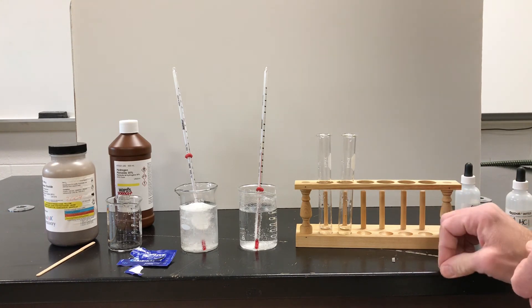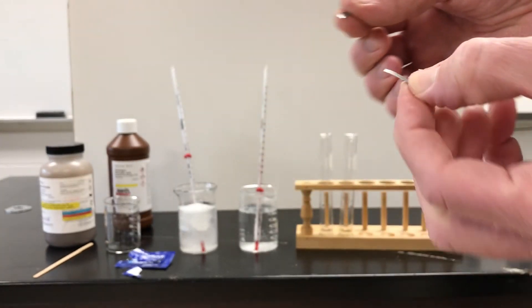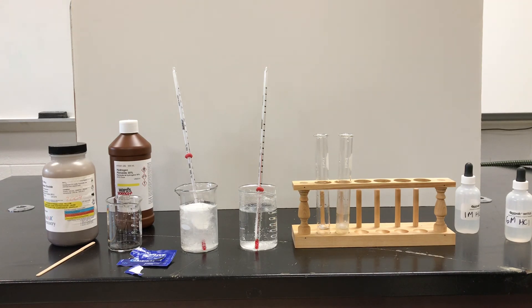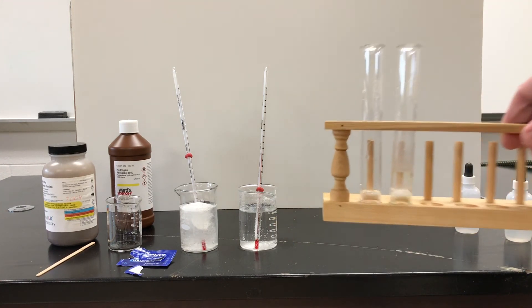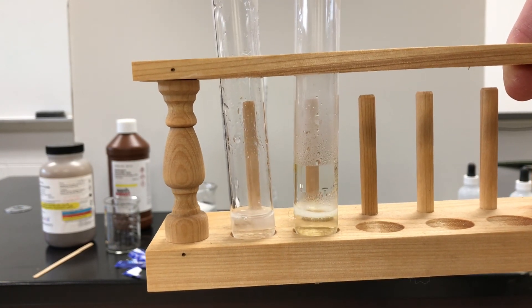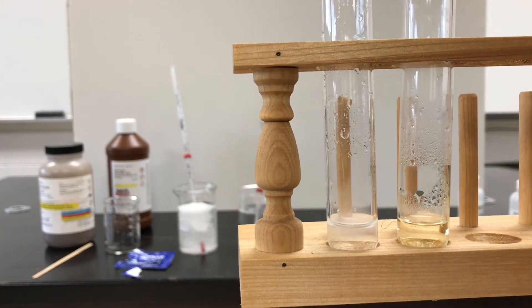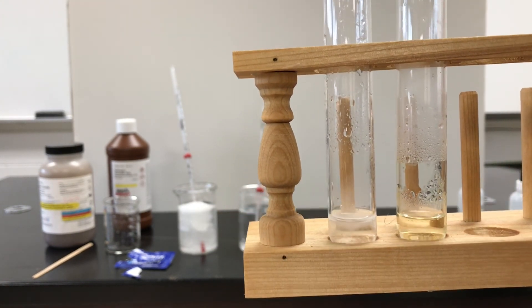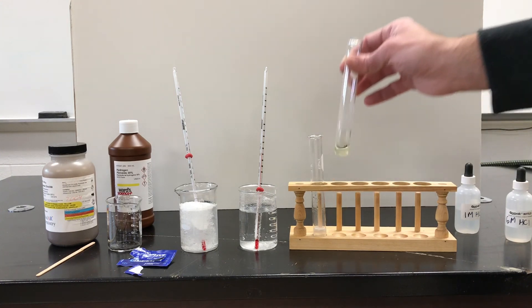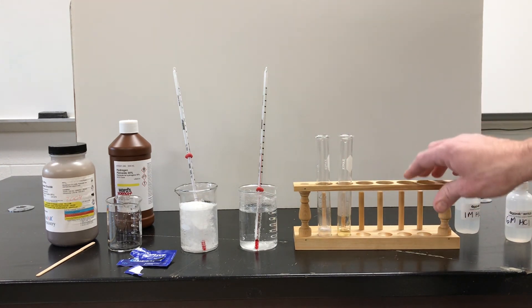I have two little pieces of magnesium here, which are going to react with the acid, and I'll put them in at the same time. We would expect that the more concentrated acid is going to eat at that metal much quicker. And you can see that it most certainly is. The one with the more concentrated acid has already eaten that piece of metal completely — it's no longer there — whereas the one molar is still trying to chew away at it. Obviously, higher concentration reactions happen quicker, and higher temperature reactions happen quicker.